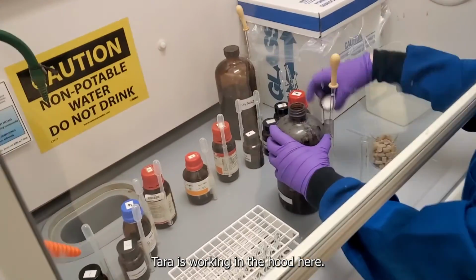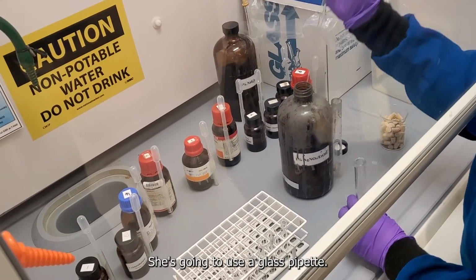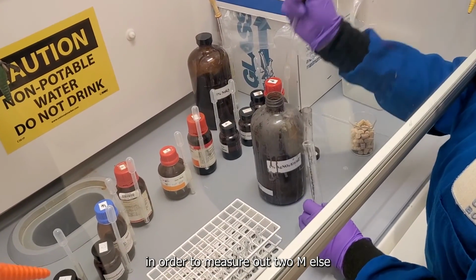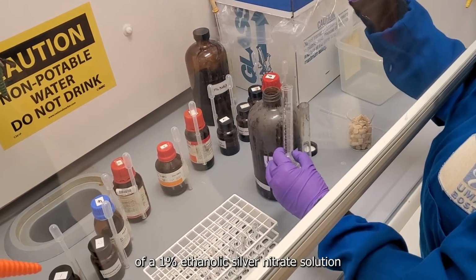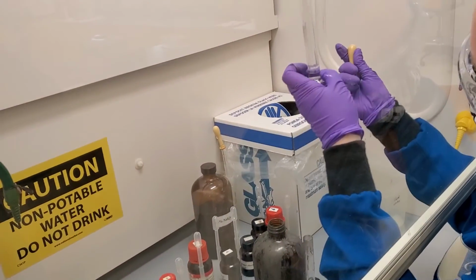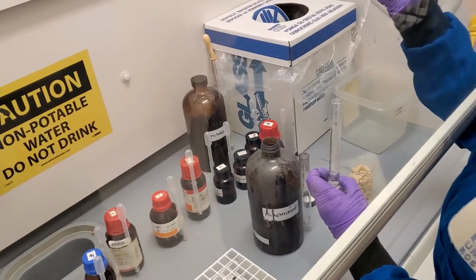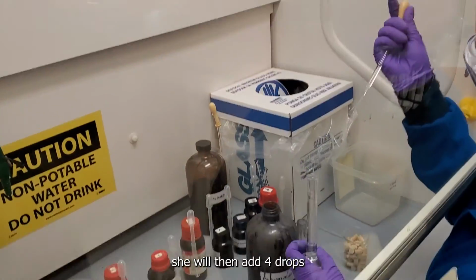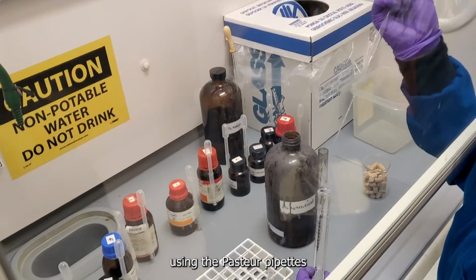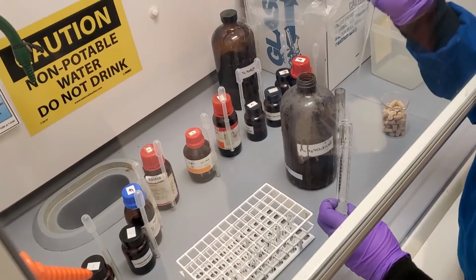Tara is working in the hood. Here she's going to use a glass pipette and a graduated cylinder in order to measure out 2 mLs of a 1% ethanolic silver nitrate solution into each test tube. Once she does that, she will then add 4 drops using the Pasteur pipettes into each test tube.